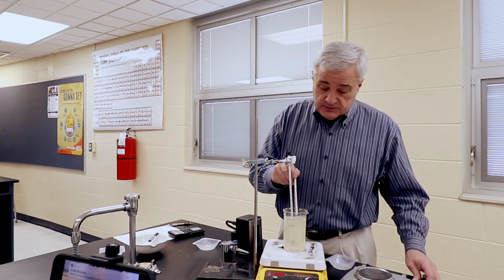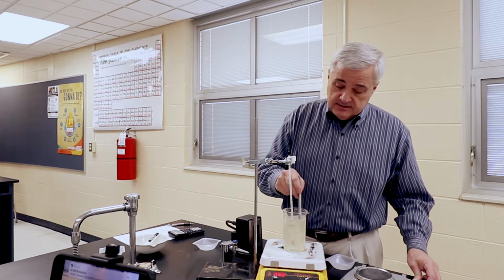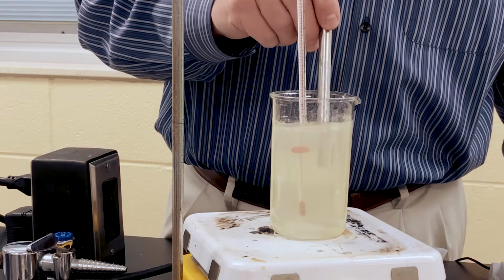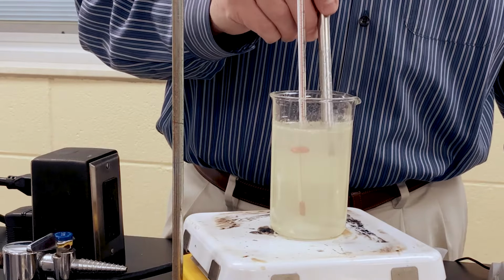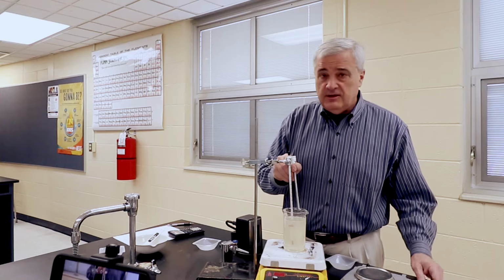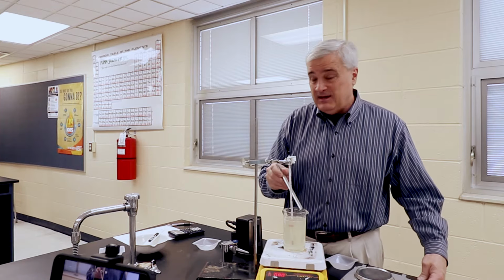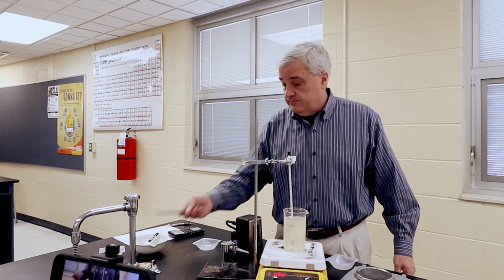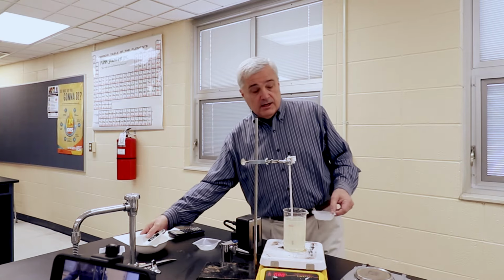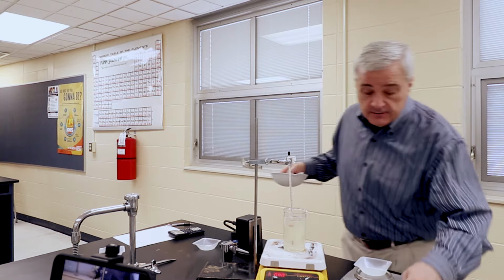It is really notably thick. I've stirred water before, and this is definitely different. It's like the thickness of maybe a polyurethane stain or something. All right, we'll zero the scale.